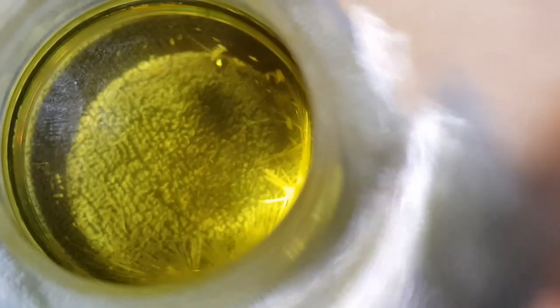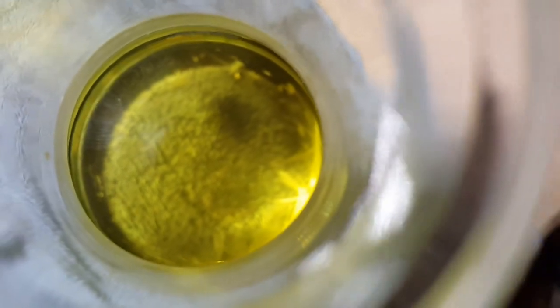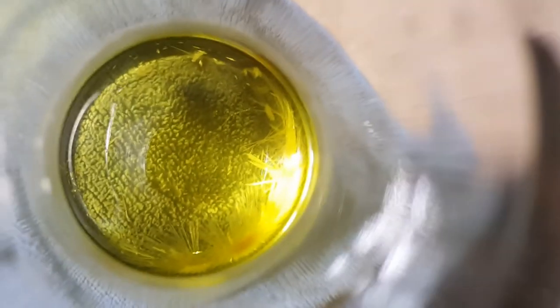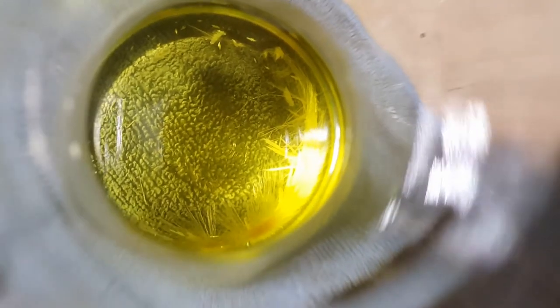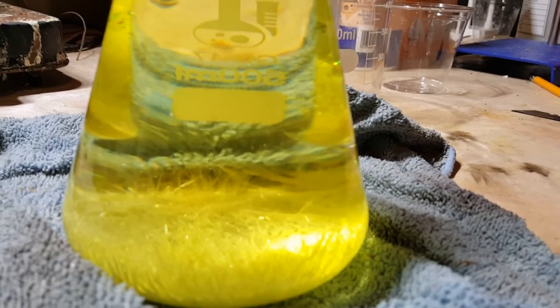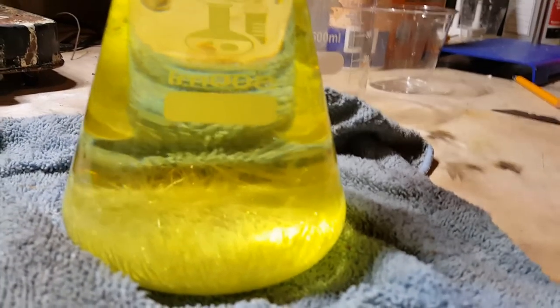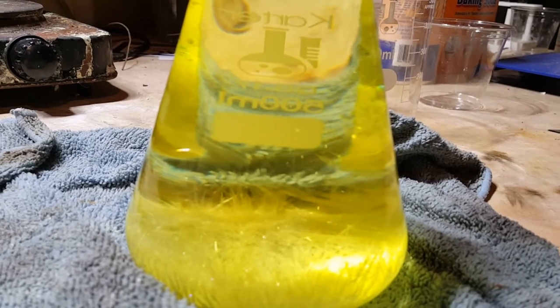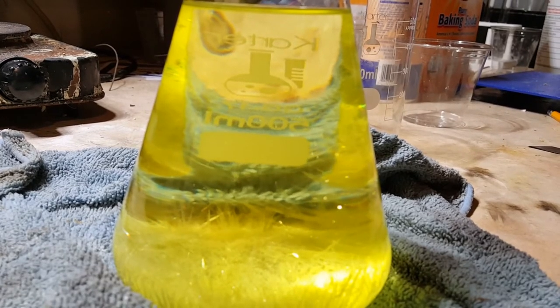It appears that these tiny rhombic crystals of sulfur act as seeds for the monoclinic needle-shaped crystals. The sulfur first grabs onto itself to precipitate out of solution as a rhombic crystal, and then more sulfur molecules grab onto that rhombic crystal and precipitate out as needle crystals. The crystals are first precipitating at the bottom, where the solution is cooling fastest. Now that the top layer has cooled enough, you can see tiny crystals of sulfur precipitating out of the solution there too.